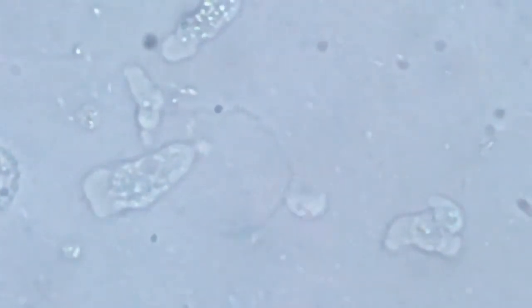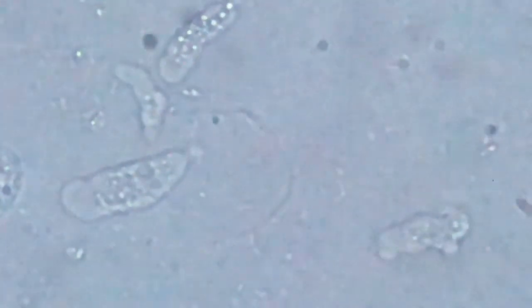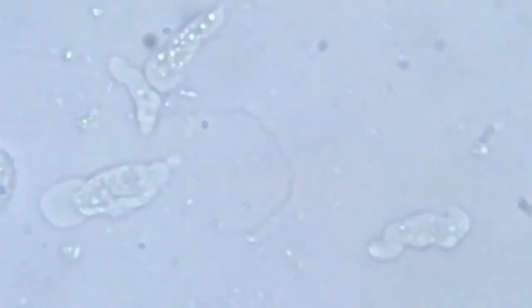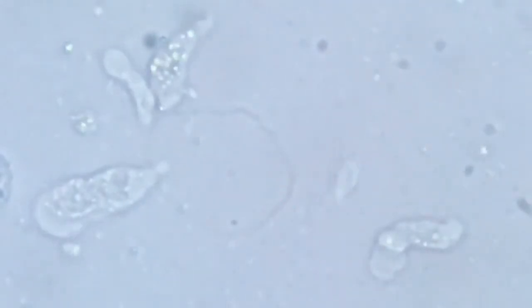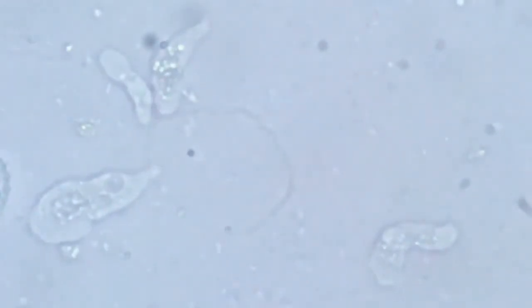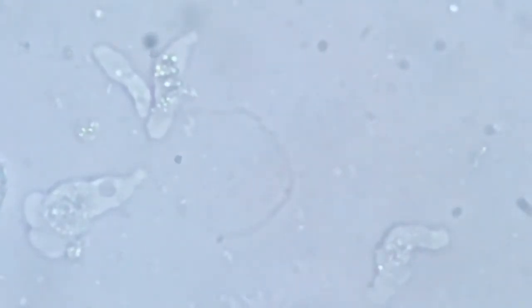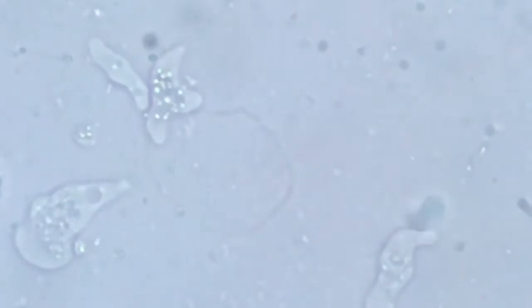At times, I think, can amoeba be cannibalistic? Can a larger amoeba predate upon a smaller amoeba? Because you see, it would be so good. You will not have to overcome something which you are not aware of.